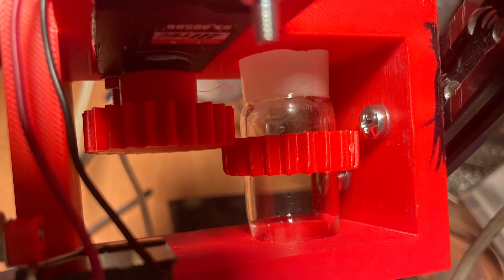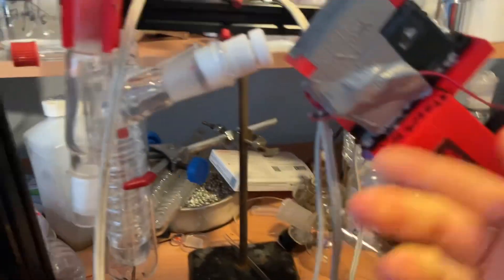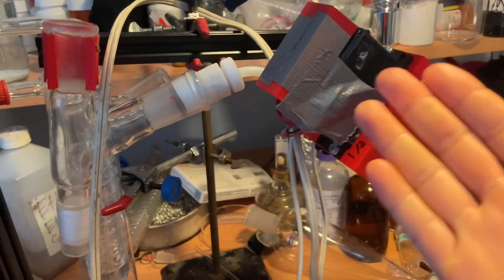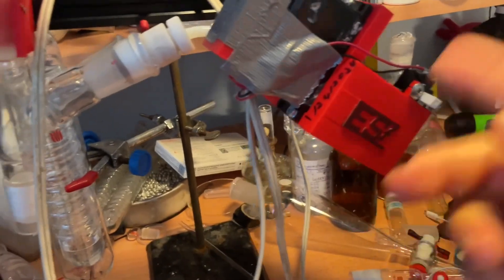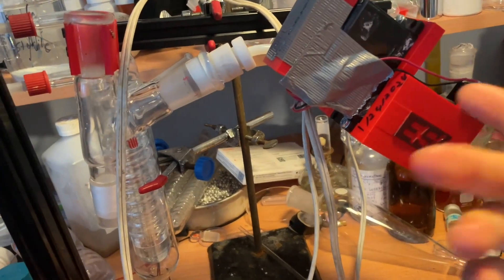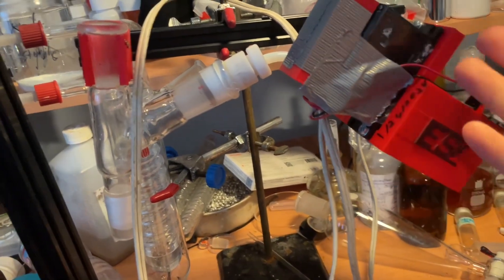It's really not the best design but it works. That's how you make a really cheap rotavap. I'm also going to set up a glycol chiller to reach sub-zero temperatures for the condenser cooling because I want really good efficiency.